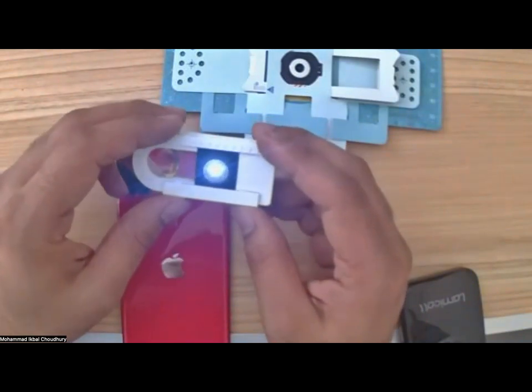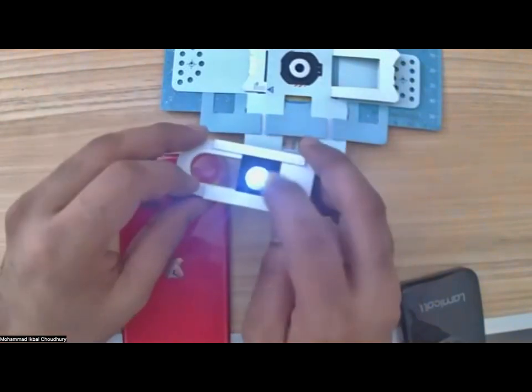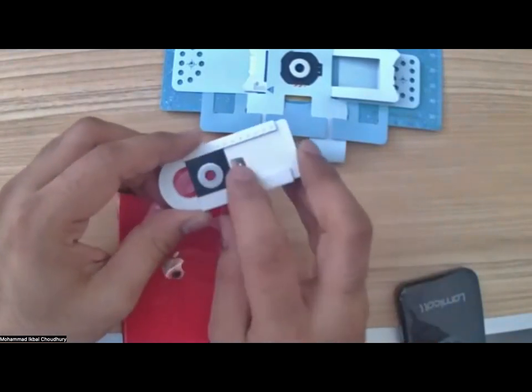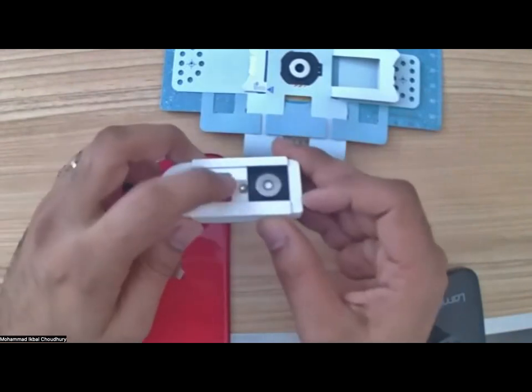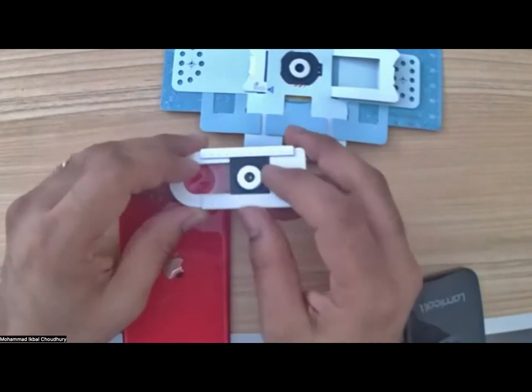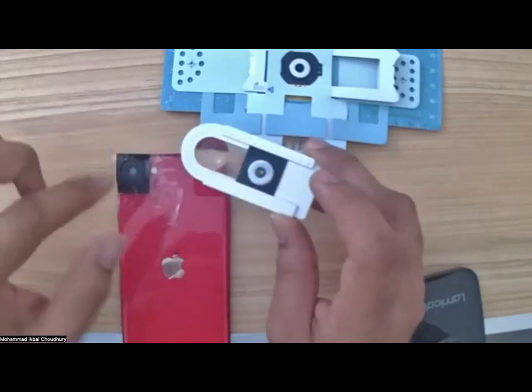there is something that I just realized, that you may or may not have the magnetic adapter connected to your light source. Let me just switch the light source off. If you move it here, you can see that there's an LED light source, and all you have to do is slide the magnetic adapter. It's the exact same magnetic adapter that you have connected to your cell phone.